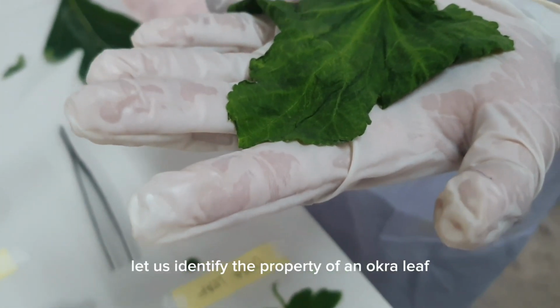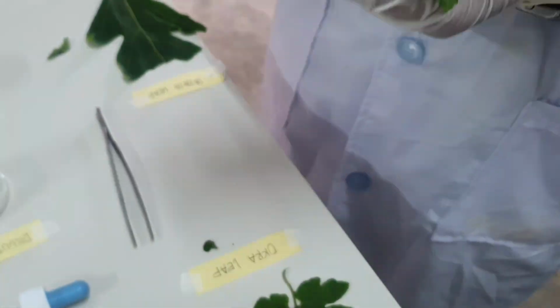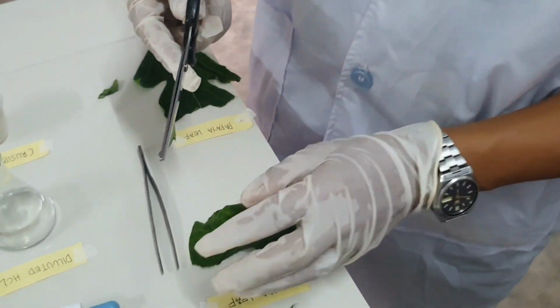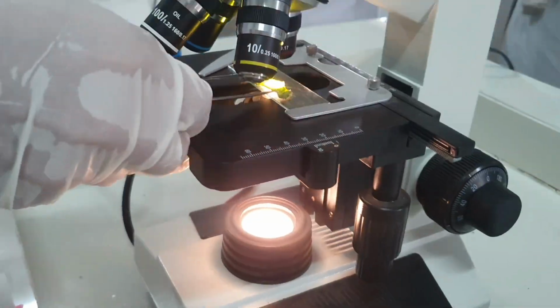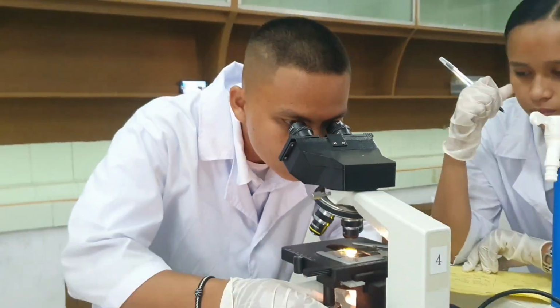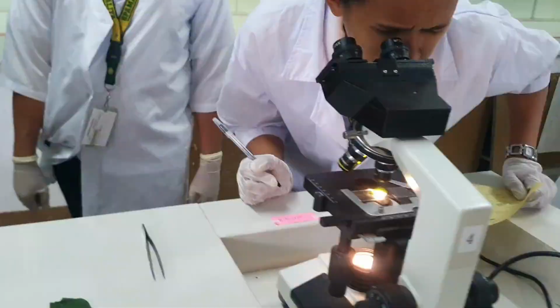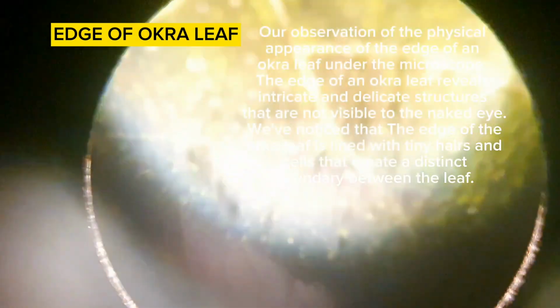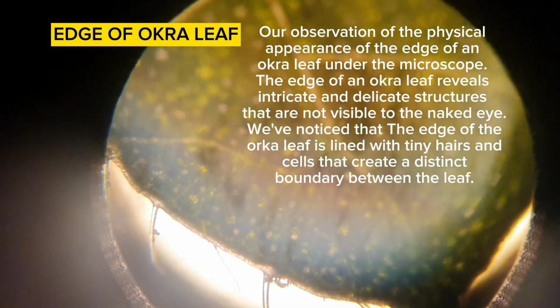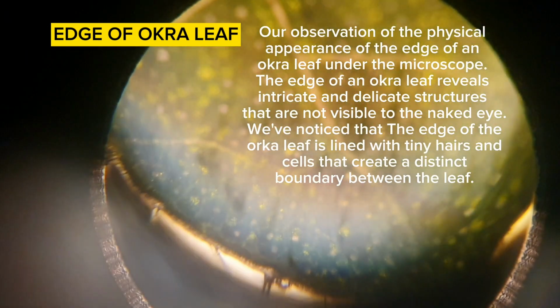Let us identify the properties of an okra leaf using the compound microscope. Our observation of the physical appearance of the edge of an okra leaf under the microscope: the edge reveals intricate and delicate structures that are not visible to the naked eye. We've noticed that the edge of the okra leaf is lined with tiny hairs and cells that create a distinct boundary for the leaf.